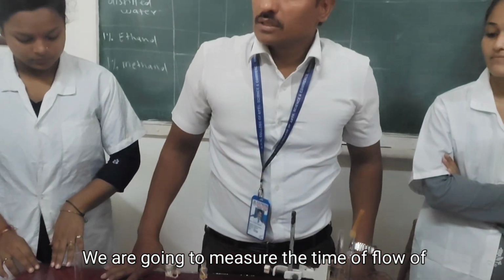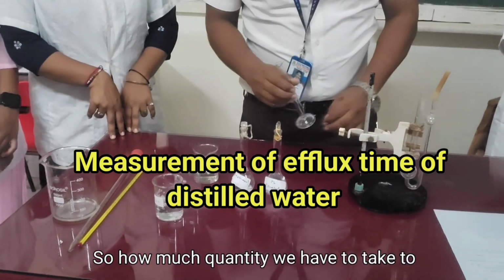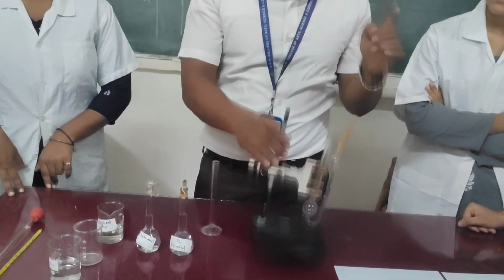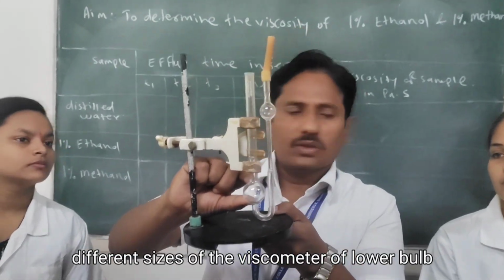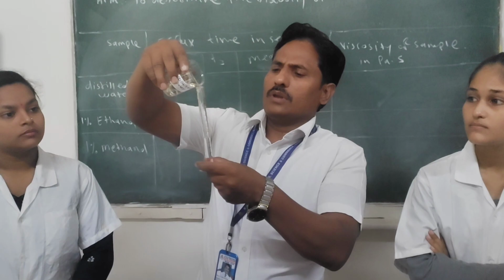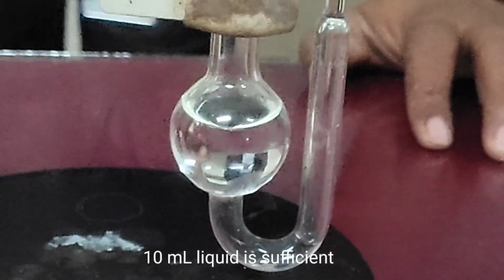We are going to measure the time of flow for distilled water first. Then we will compare with the other liquids. How much quantity should we take? A sufficient but definite volume, the same volume for all liquids. It depends on how big or small the bulb is, because every viscometer has a different bulb size. Transfer 10 ml of this water. Don't take more than 10 ml.